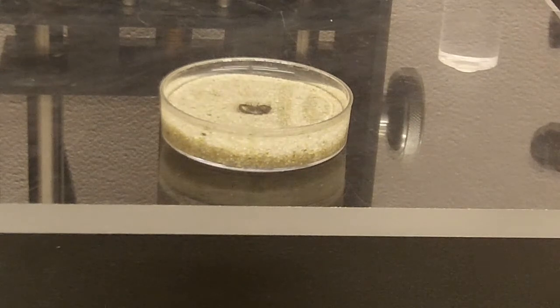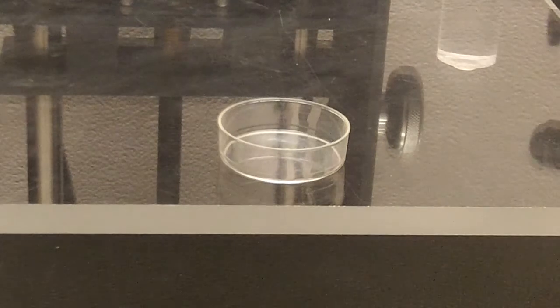That's how to image an ethanol specimen in sand. And now I'll show how to prepare a specimen for gel.